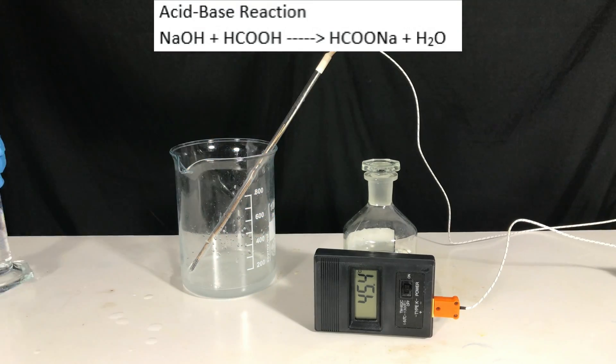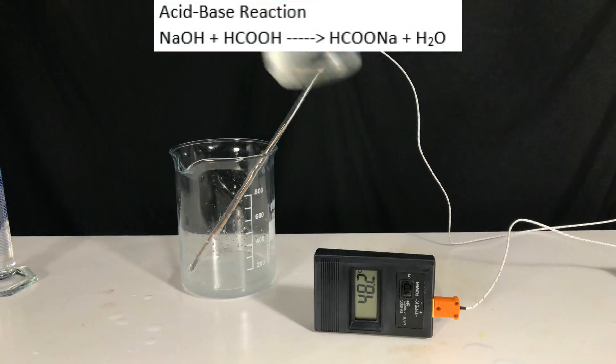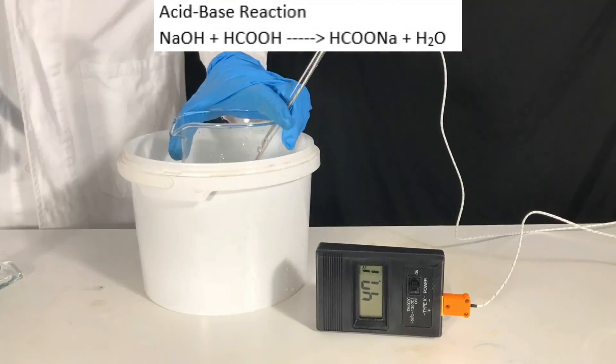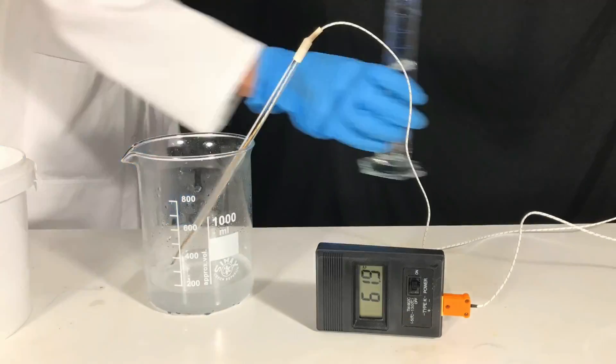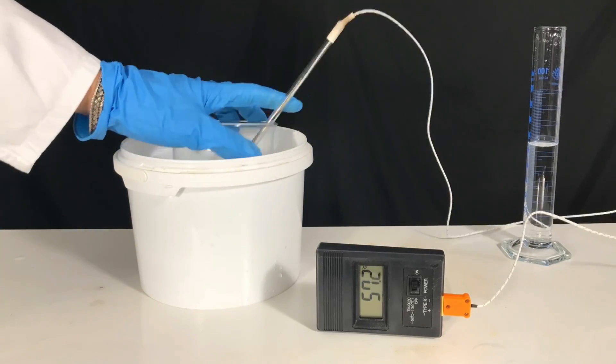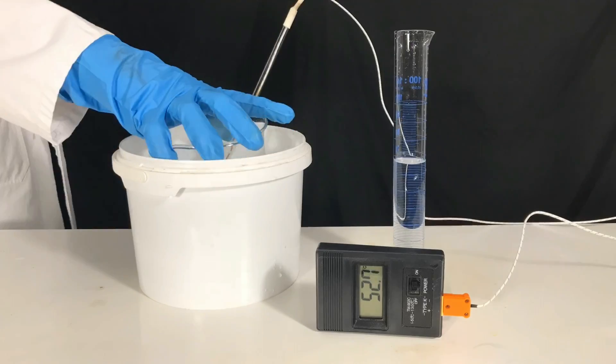The reaction taking place is an acid base reaction. Sodium hydroxide and formic acid react to form sodium formate and water. Like you were able to see, this reaction is highly exothermic. Therefore, a water bath was used to cool down the beaker occasionally.